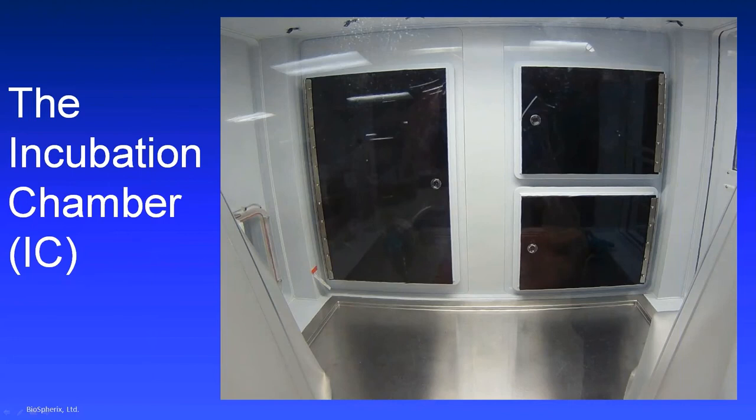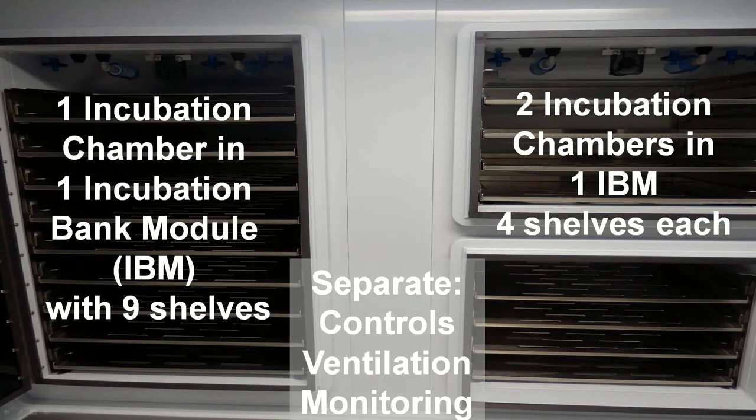So let's talk about the incubation chamber a little bit. It, like I said before, opens only into this controlled cell processing space, so cells aren't exposed to the variabilities of room air. Each one is independently controlled and ventilated. Each incubation chamber is in an incubation bank module.